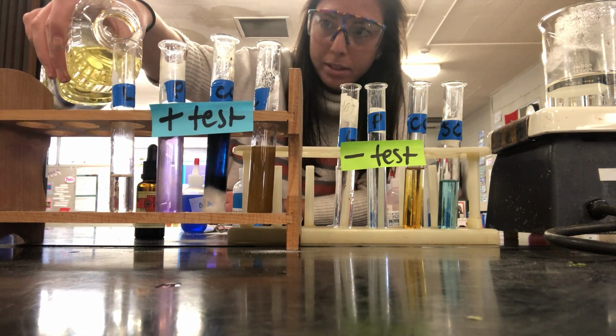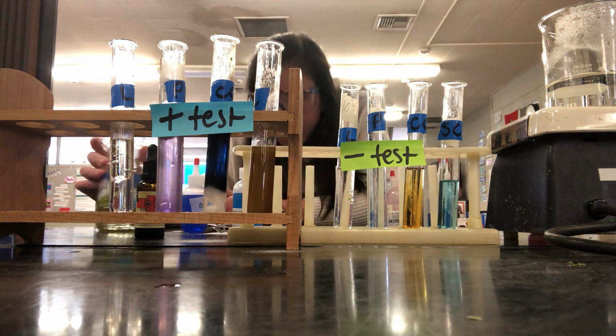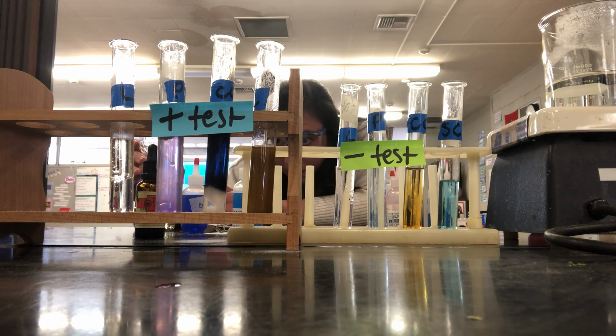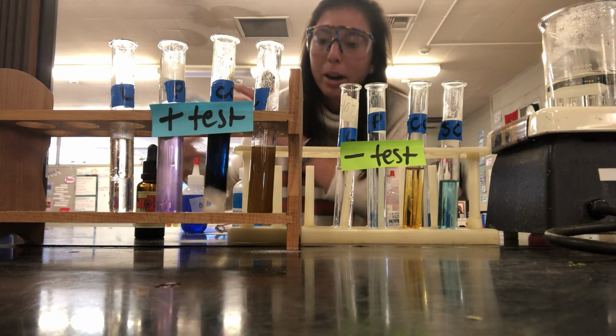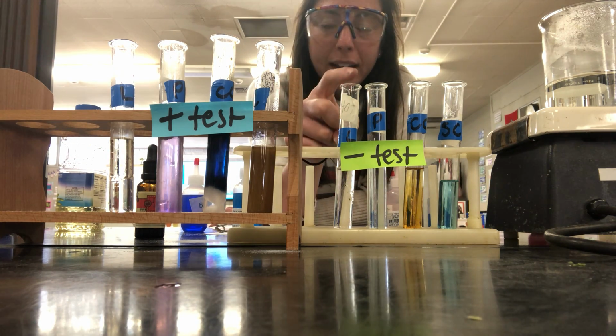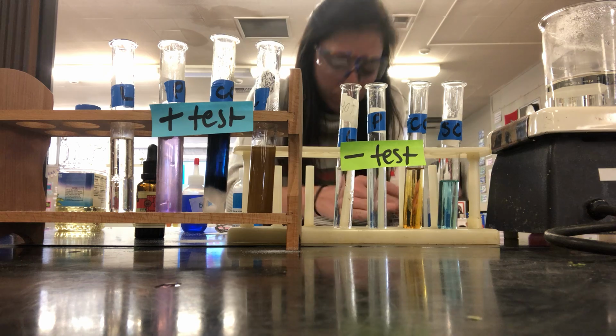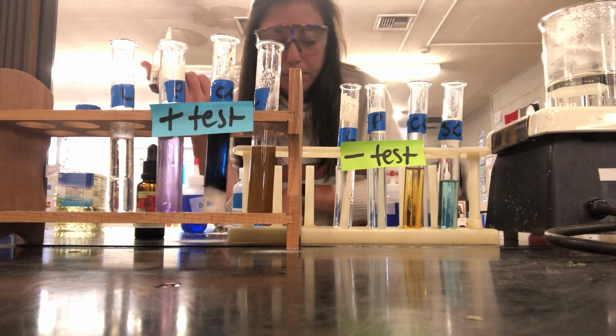And if you know what happens to water and oil when they mix, they don't mix. When they touch, they don't mix. So our oil separated to the top and the water separated to the bottom. It's about half and half. So you're going to want to do the same thing. You're going to add a little water to your test tube. And then my negative test over here is just plain water. So we'll start with the positive test, since that comes next in your columns.